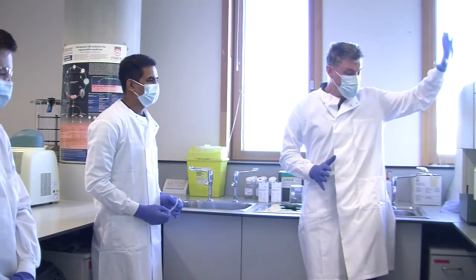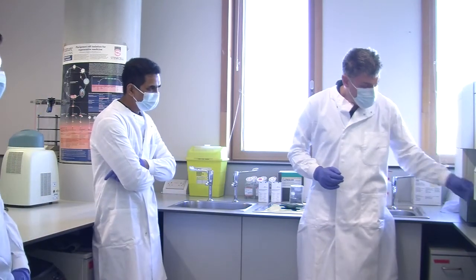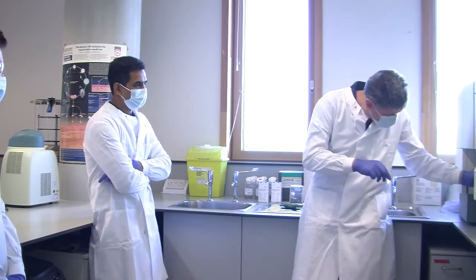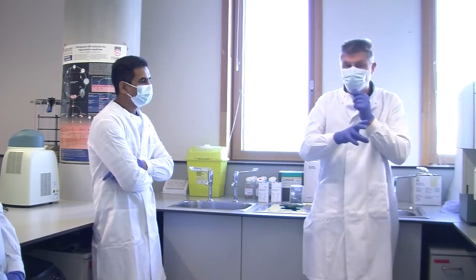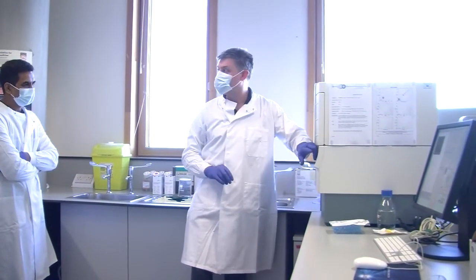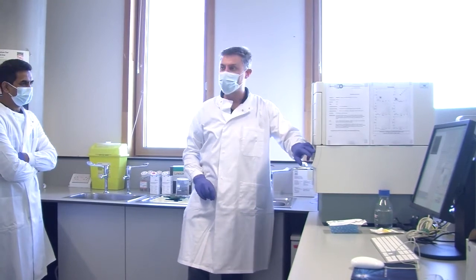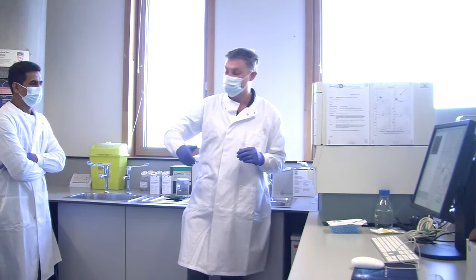So, here we have the flow cytometer. There's not a lot on the outside. We have our standard flow cytometry tube, just little polystyrene tubes. And they go onto a little metal needle that takes up our sample. And then we've got some control buttons. That's about it. And actually our control buttons are very, very simple. We've got one that's low, medium and high. That's how fast the cells run through the system.